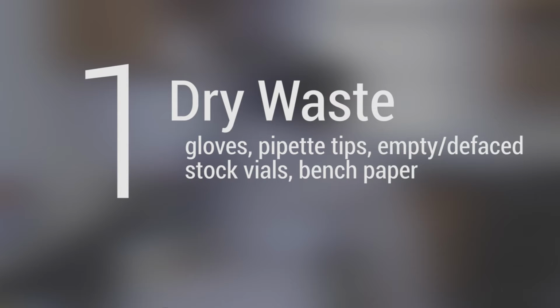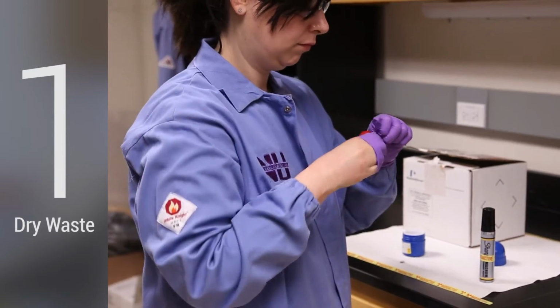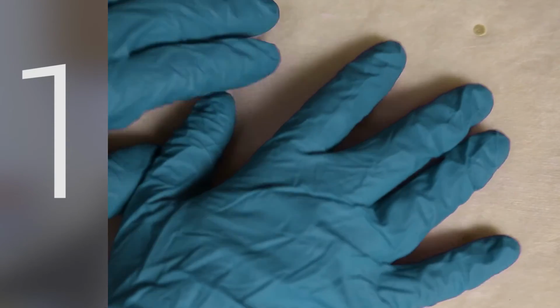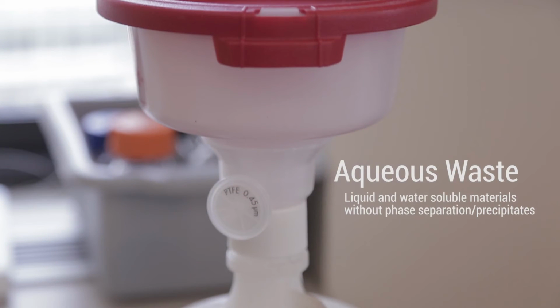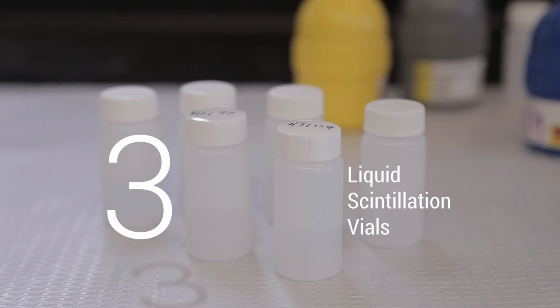Dry waste includes gloves, pipette tips, empty defaced stock vials, and bench paper. Absorbed liquid may also be put into the dry waste container. Aqueous or liquid waste includes liquid and water-soluble materials in quantities and forms that do not result in phase separation or precipitates. Vials that contain liquid scintillation cocktail.